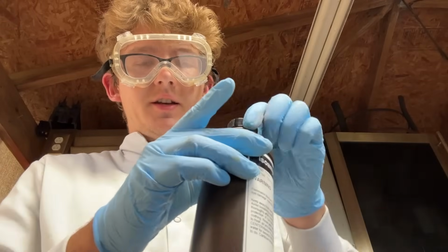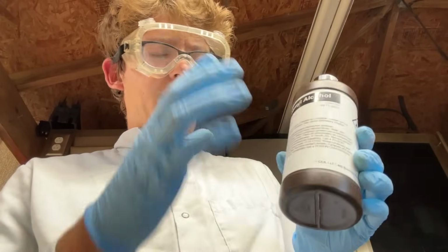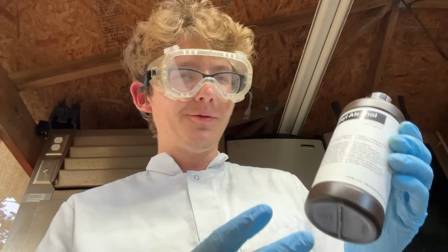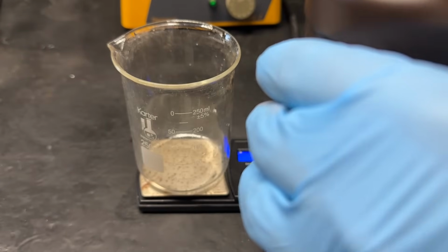It's actually a very nice smell. But yeah, I would say it smells kind of like a whiskey, but more fruity, and less of the burn. That left a weird feeling in my throat. Almost like it's coating my throat. It's very, very weird. So, I need 18 grams of it in total.